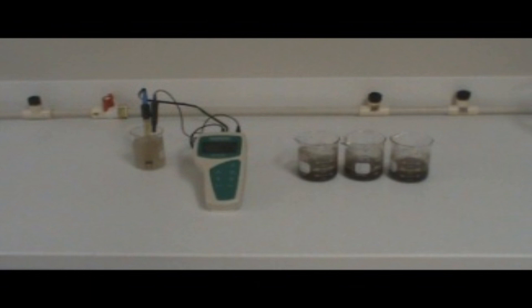Although we have not shown it here, be sure to clean off your probe after taking measurements of these samples to allow for future use. You now have a value for the pH of your soil.